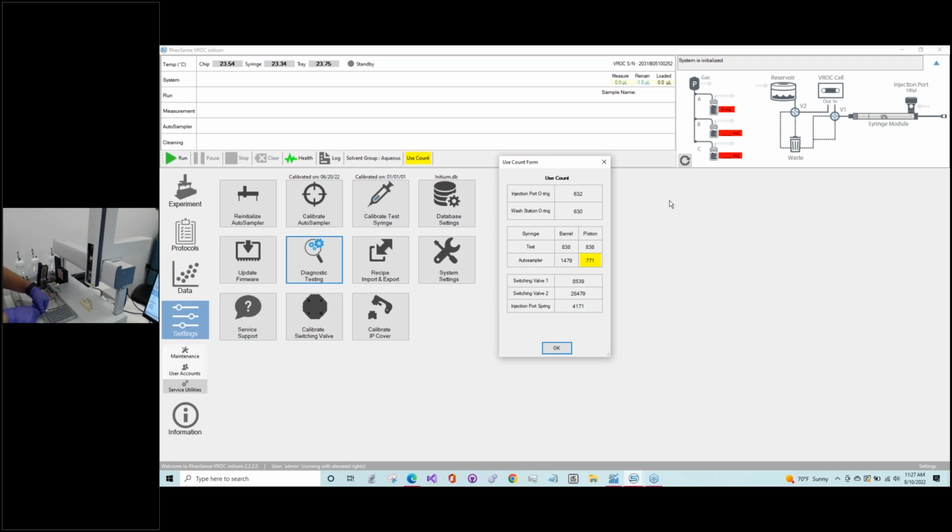I ask it nicely, am I? Come on. So I guess some of the lab users here are a little stronger than I am, but heavy-handed with the screw.